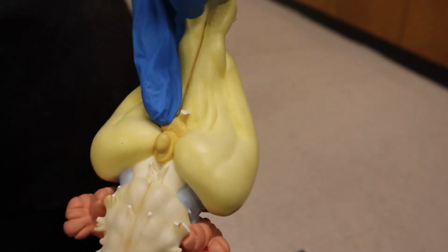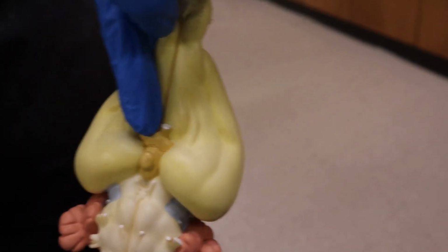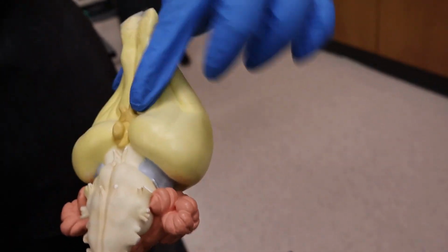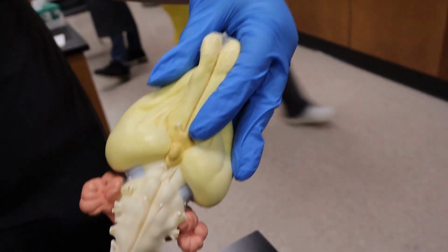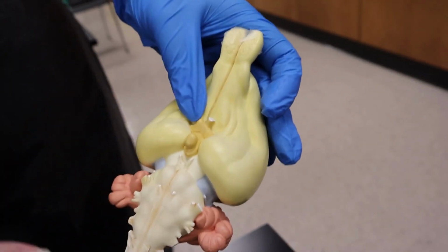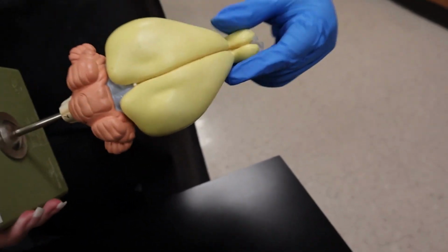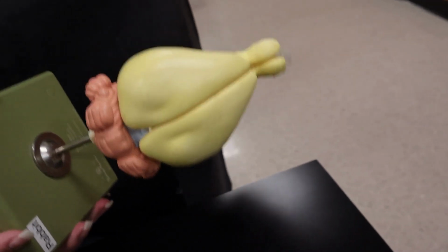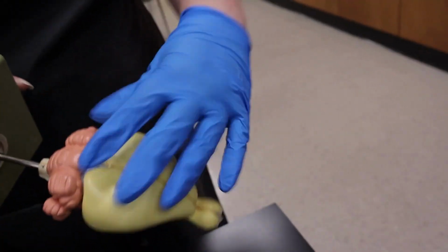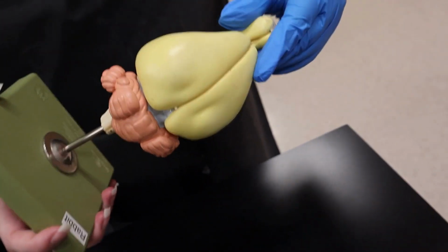Alright, so we have the darker yellow color, which is going to be our diencephalon, or the forebrain part. This is going to help control adaptations related to the animal knowing what's going on in its body, like hunger, body temperature, thirst, as well as its biological clocks. And then the lighter yellow right here, the main part of the brain, is going to be the cerebrum. This is the forebrain part. It's super essential in skeletal muscle contractions as well as voluntary movements, along with learning and perception. So our cerebrum is going to be the main thought pattern, allowing animals to think, as well as most mammals, as well as humans.